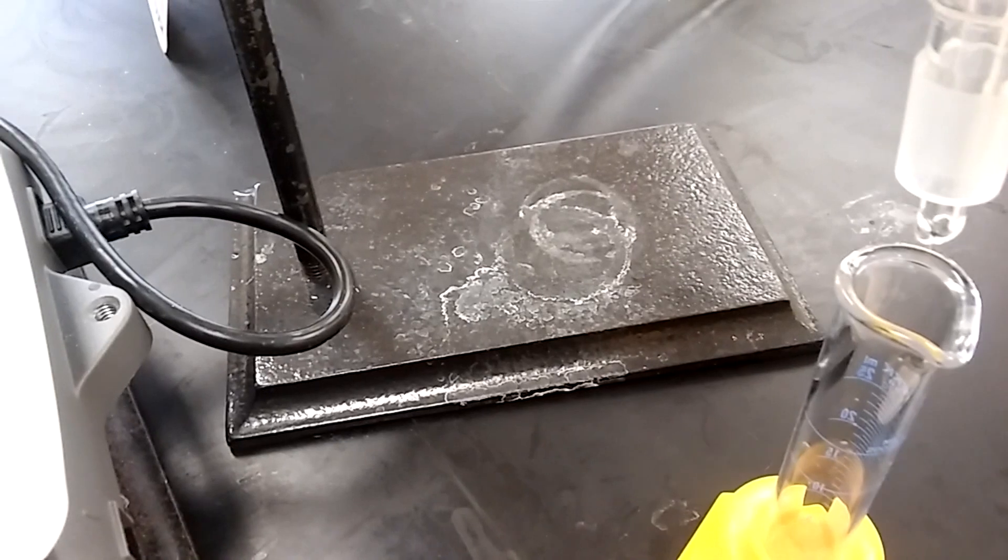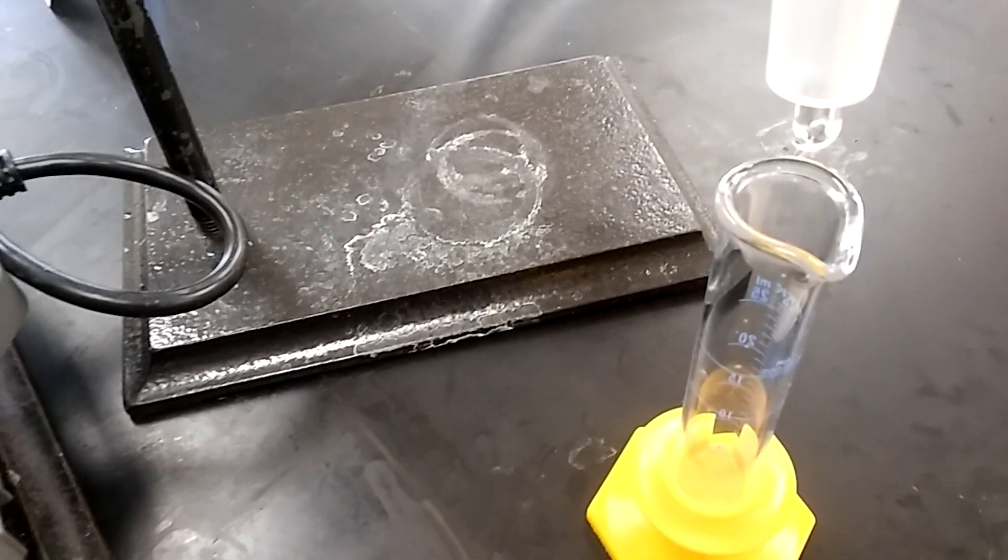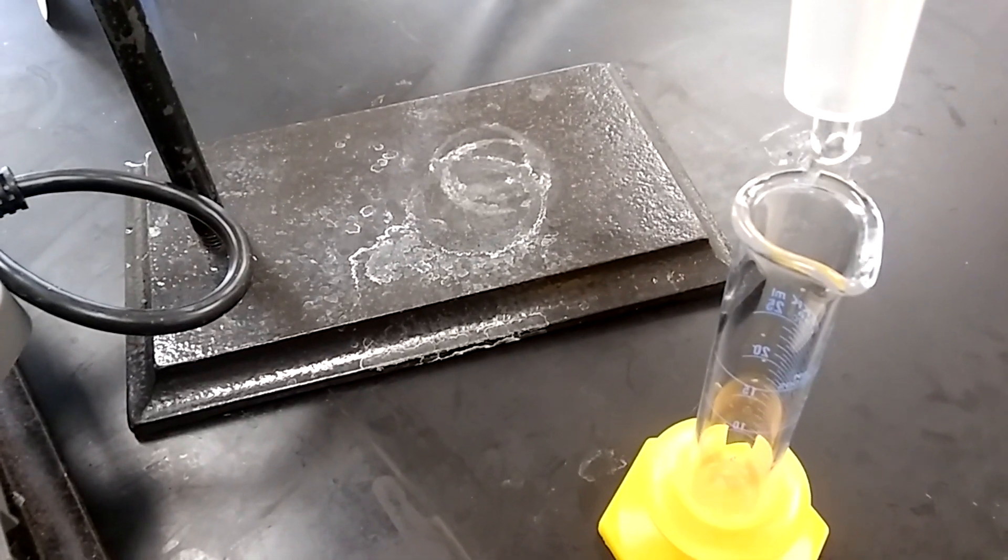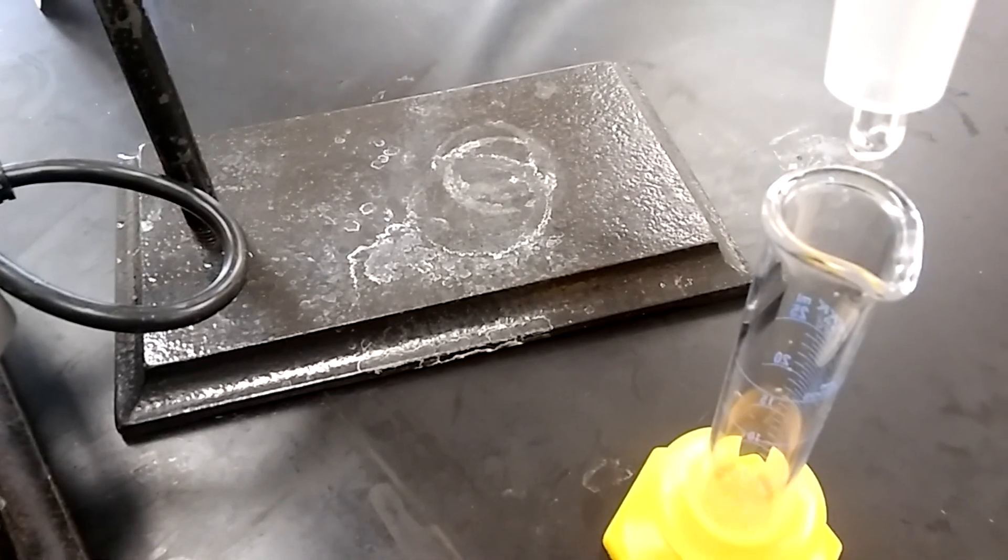You don't want anything before 49 or after 52. You'll get stuff that has a boiling point less than 49 - we don't need that. What we're getting right now is our t-butyl chloride and then we'll be done with our lab.